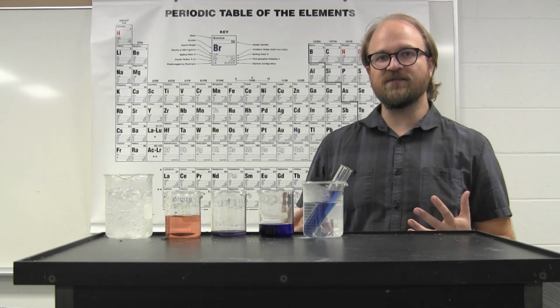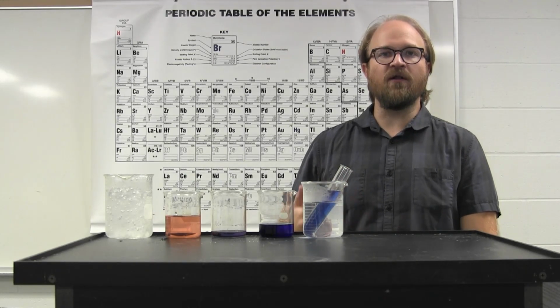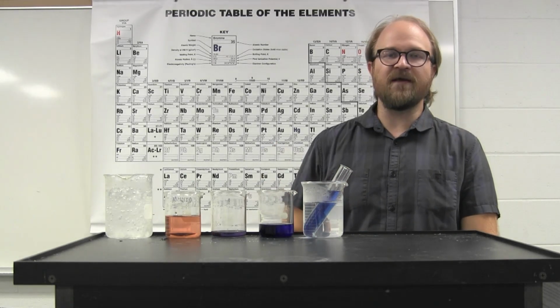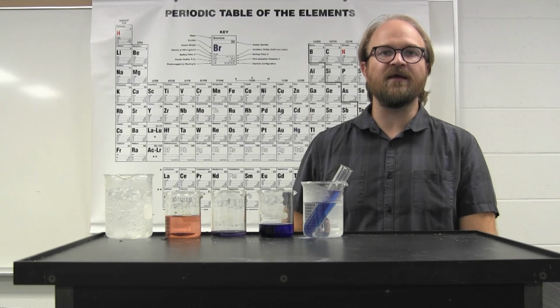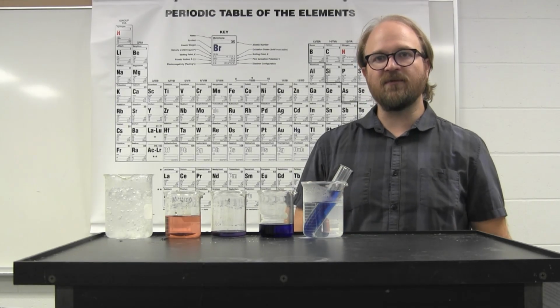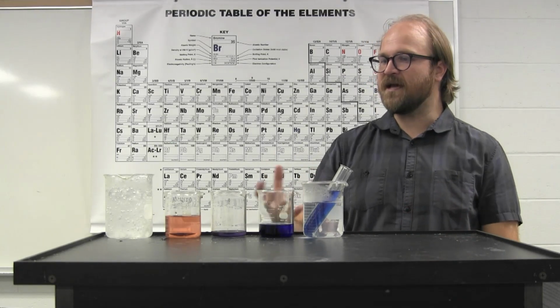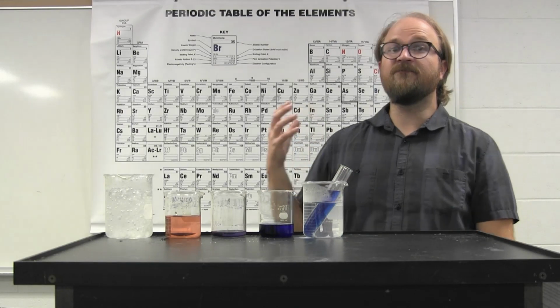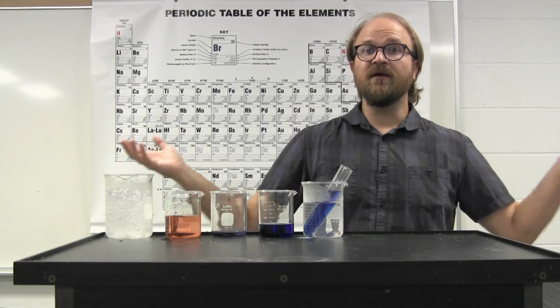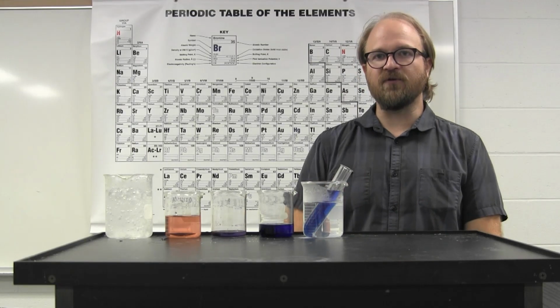As you go through this and look at all of the different observations and calculate those different equilibrium constants and thermodynamic properties, you'll get a better sense of how these types of very different chemistry concepts can be related in chemical reactions.